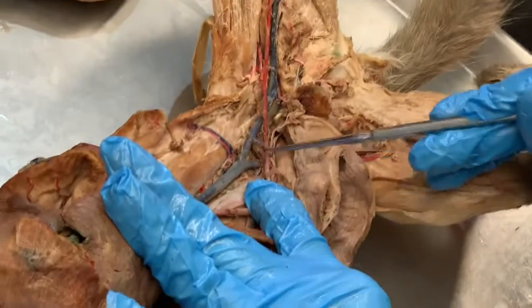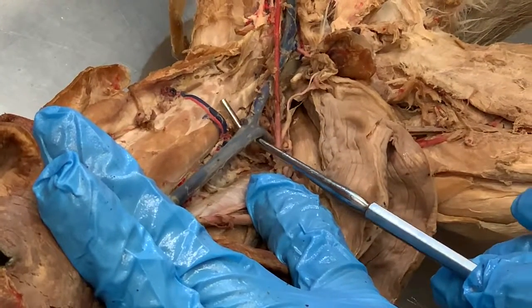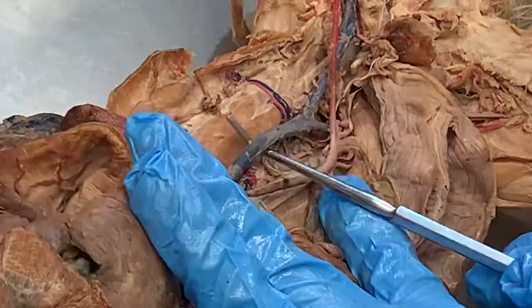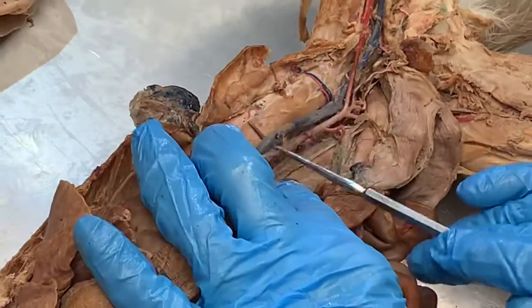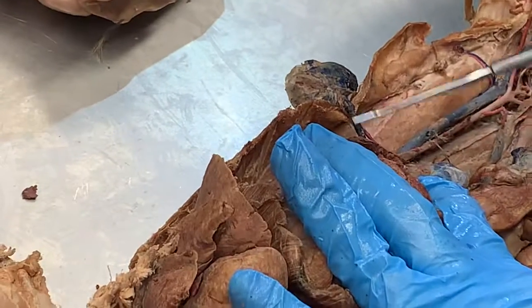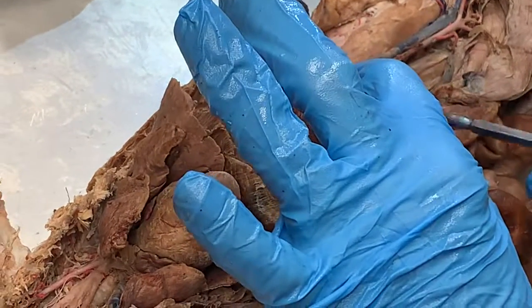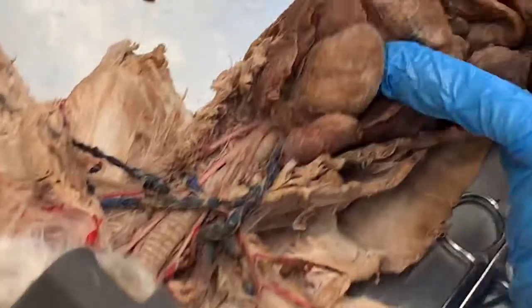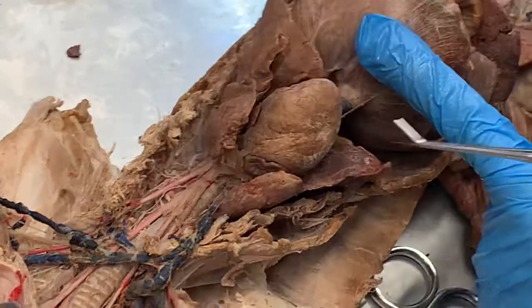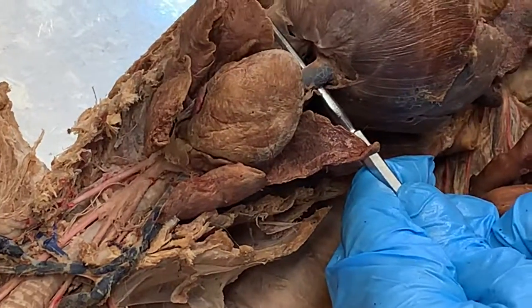So those two common iliac veins are going to meet in the middle here and become one, and where they converge and go up the center of the body, that's the inferior vena cava. Big, long inferior vena cava. The renal vein is going to come off of that and go over to the kidney. Inferior vena cava follows up, goes into the liver, comes out the top of the liver and the diaphragm, still as the inferior vena cava.